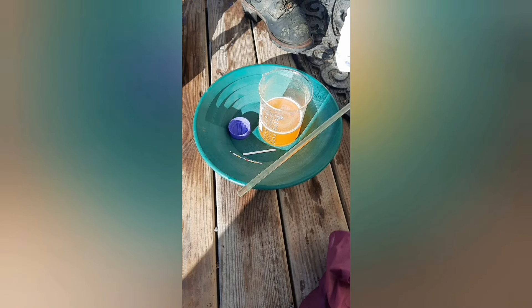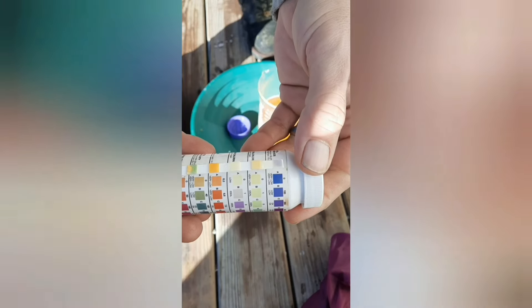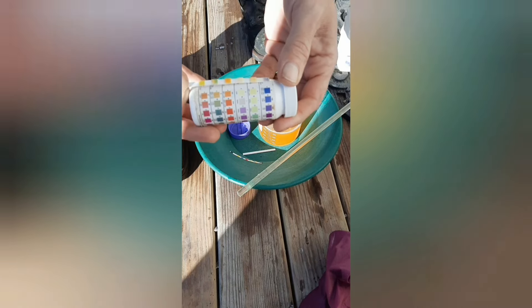Okay, let's check it again — we still have some reaction going on. Look at that — sorry about that, but that's what we're talking about. See the color on that now — we're a little bit lighter than that orange, which is good. So now we're going to go ahead and precipitate this stuff out of solution, and I'll show you how we do that.